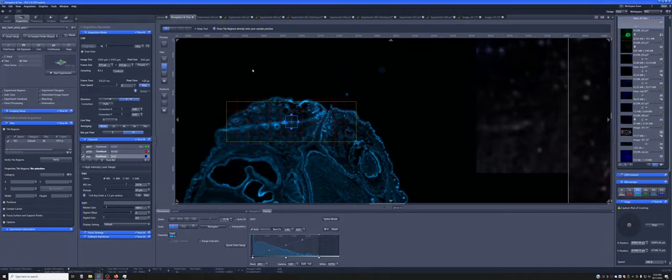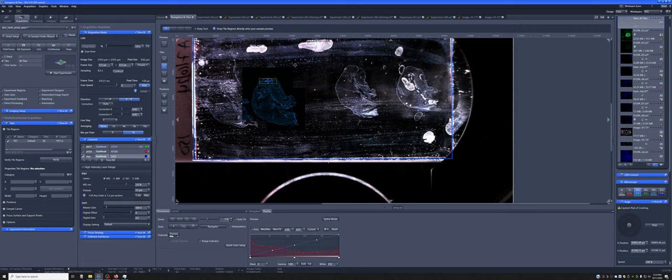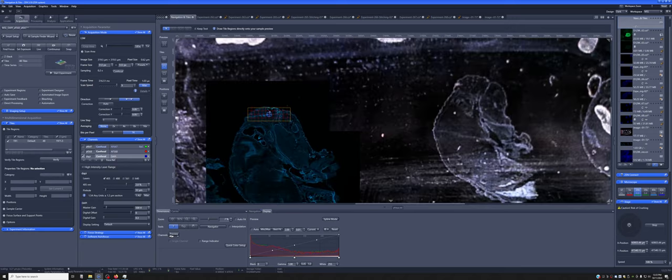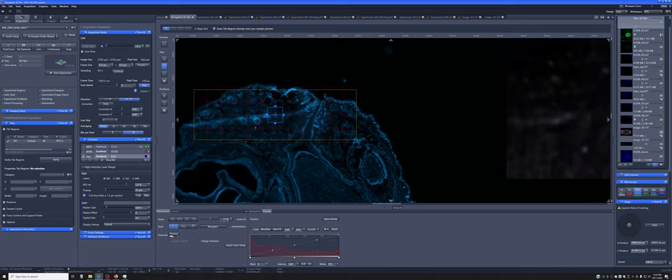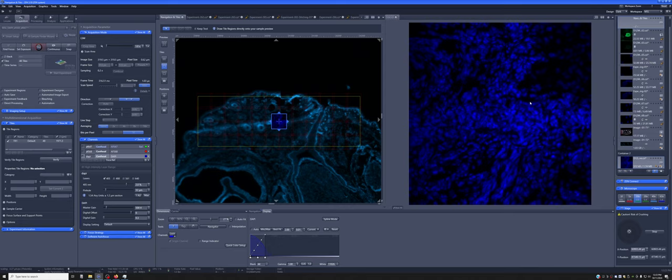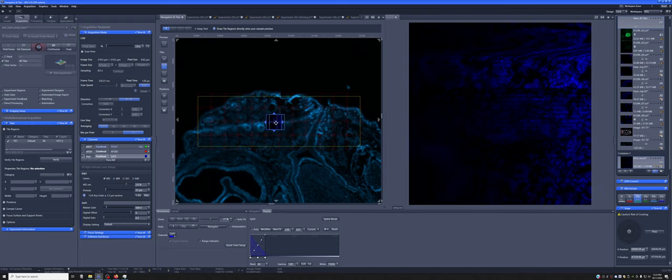This video will discuss how to take images when your sample is tilted. This is something that can happen, for example, if you have a slide where the cover slip extends to the edge and props it up from one side to the other. When that happens, as you move along the direction in which it's propped, you can see that while things may be inside the focal plane in the middle, as you move away, things come out of focus.